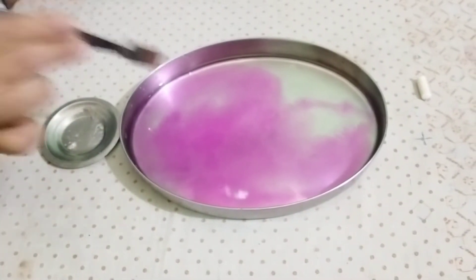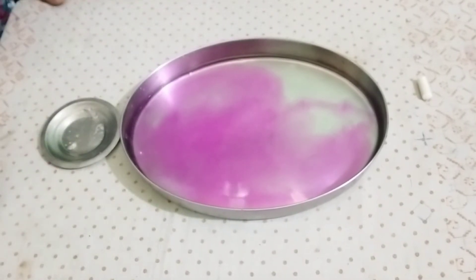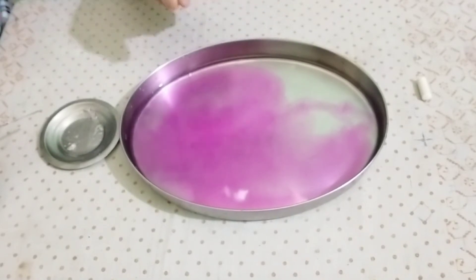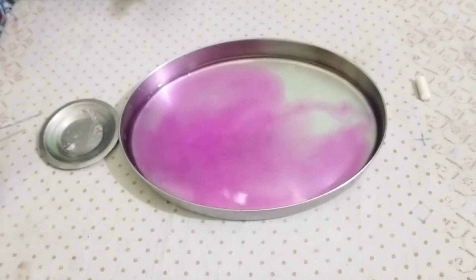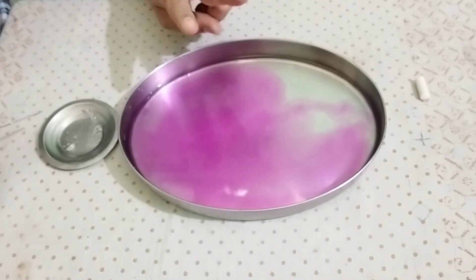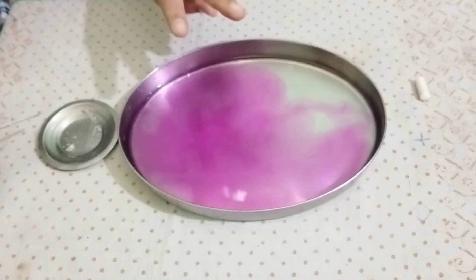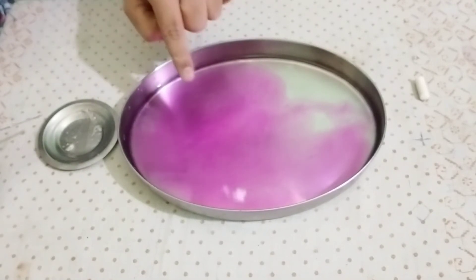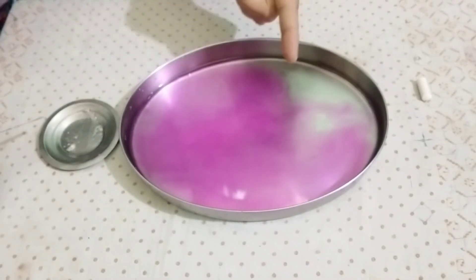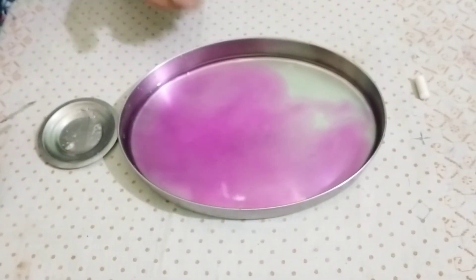Why did the colorless water turn pink? It is very simple. Along with the water, I added an indicator, which is nothing but phenolphthalein indicator. We all know that phenolphthalein is a colorless indicator which gives two colors: in acid medium it is colorless, and in basic or alkaline medium it is pink in color. This sodium metal, on reacting with water, has produced sodium hydroxide, which is alkaline in nature. That is why it has turned pink in color.